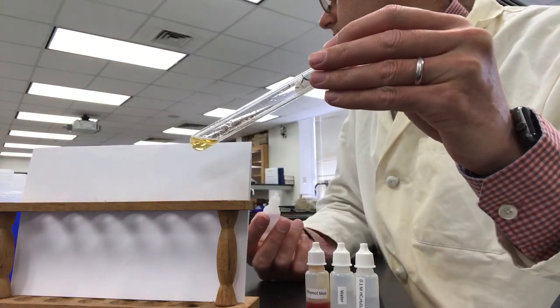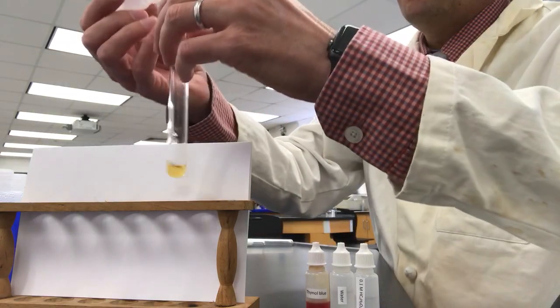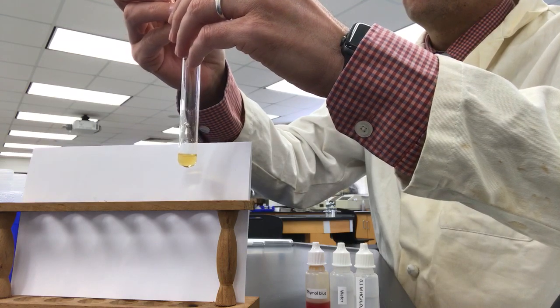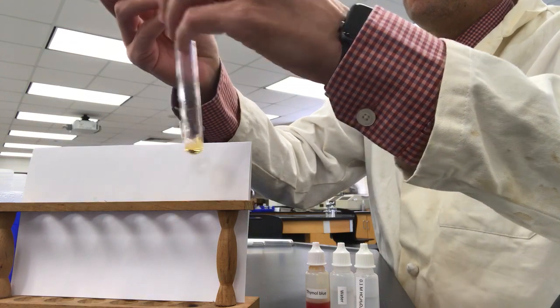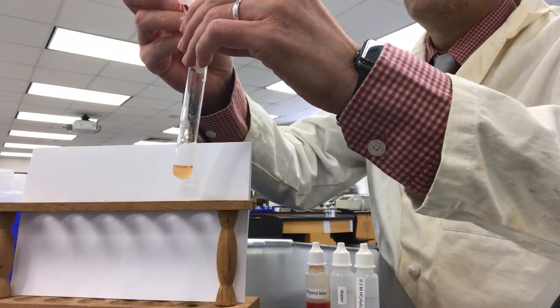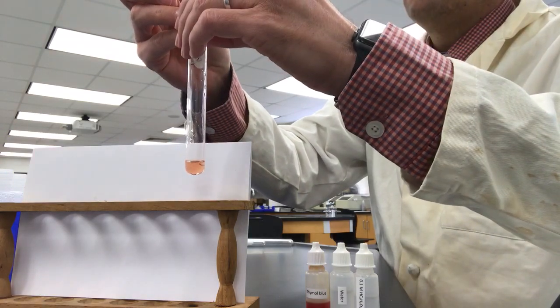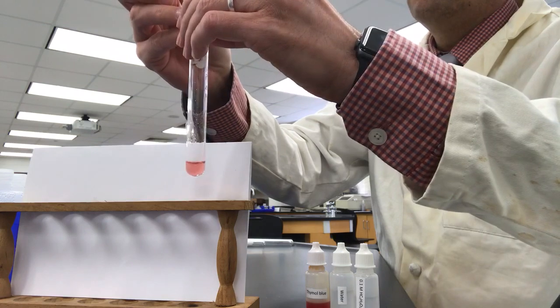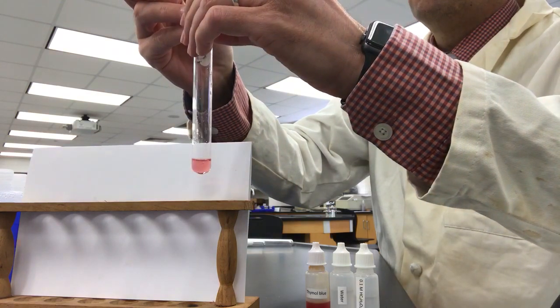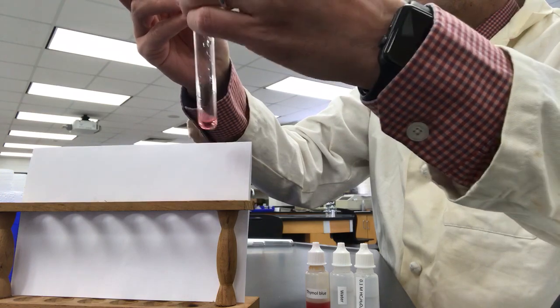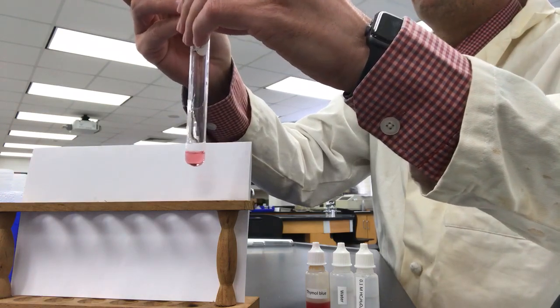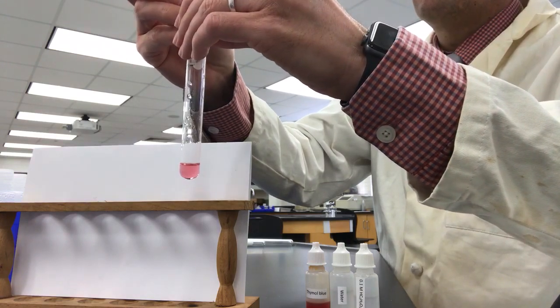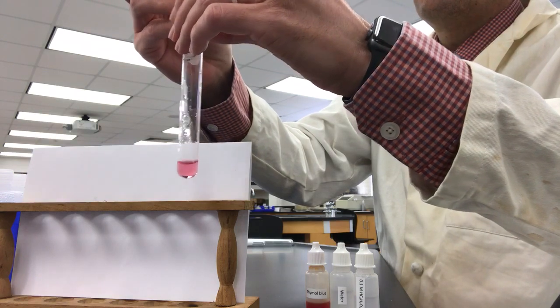And we're going to add hydrochloric acid and I'll call out the drops as I'm adding them. One drop. Two. Three. Four. Five. Six. Seven. Eight. Nine. Ten.